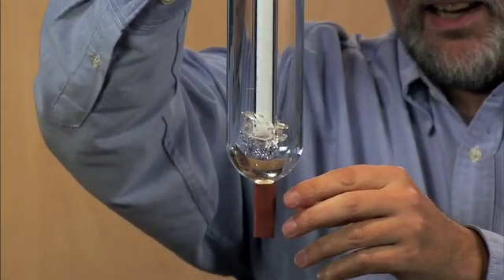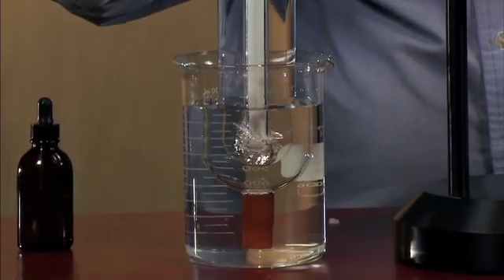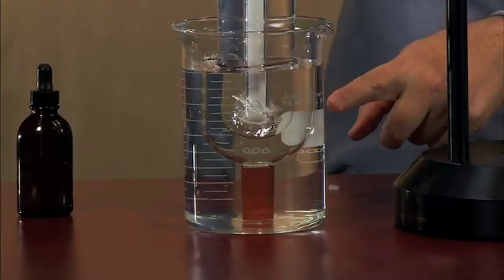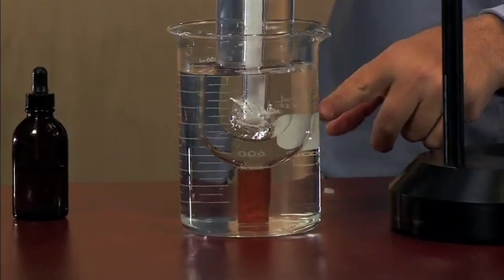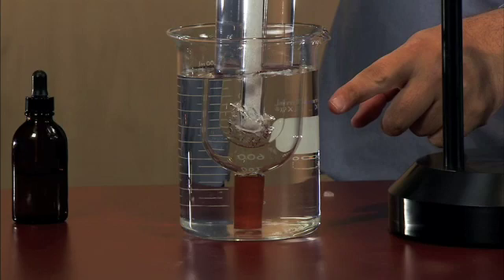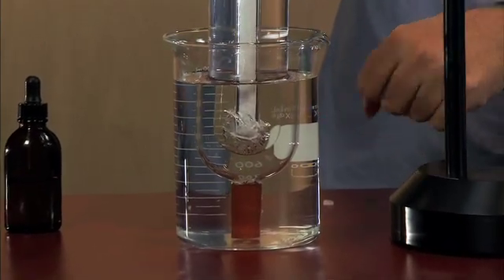I can remove the parallax. I can remove the optical distortion by setting this in a beaker full of water. Everything is magnified, but it's magnified equally now. And we can see there's still quite a gap between the ice mantle and the sides of the cell.